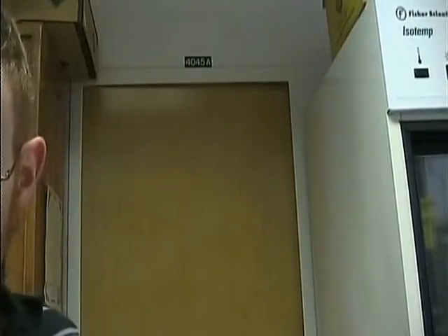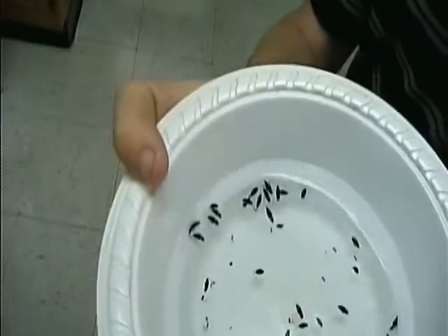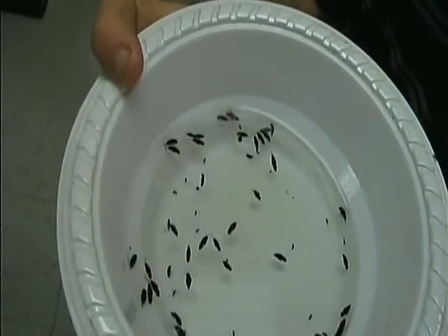After a few days, your bowl might look something like this. It'll be filled with little insects, perhaps some bigger insects. Most of these insects are not the wasps of interest, but the easiest way to transfer everything is to put everything into the vial. If you're feeling adventurous, feel free to remove some of the larger insects like spiders and grasshoppers — a forceps or your hand will do for moving them out.